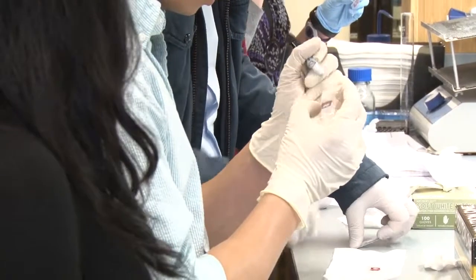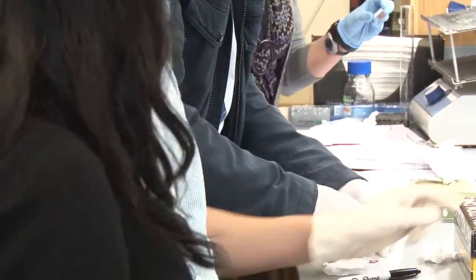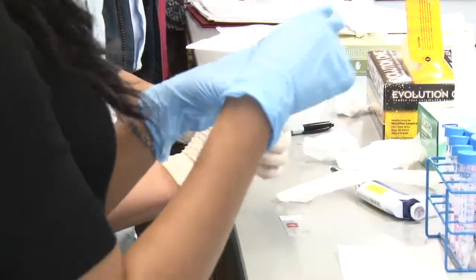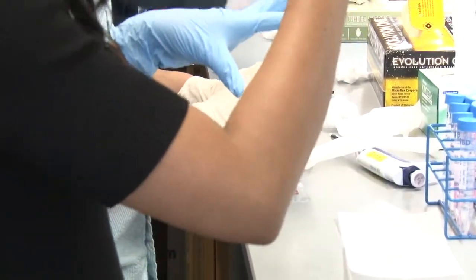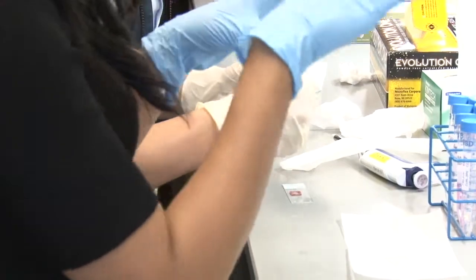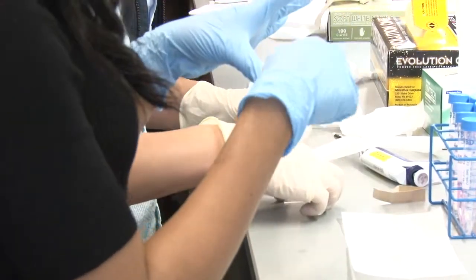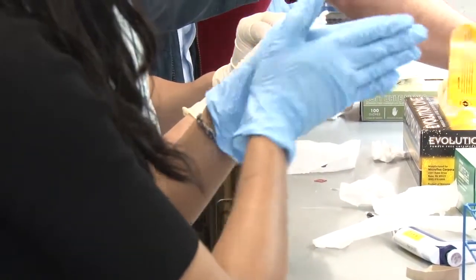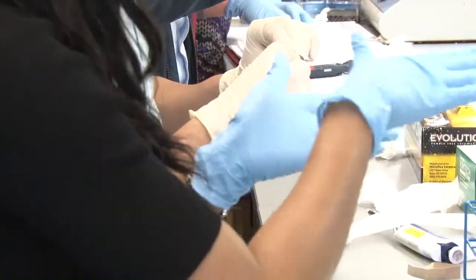They used to have a different company that sold seal chambers which had super sticky adhesive — this one is better. If you have any residual adhesive left on your slide, make sure you remove it. Because when you put a cover slip, it's not going to be directly sitting on the slide, and when you image you might find it's not flat.